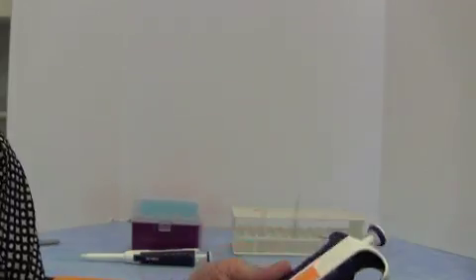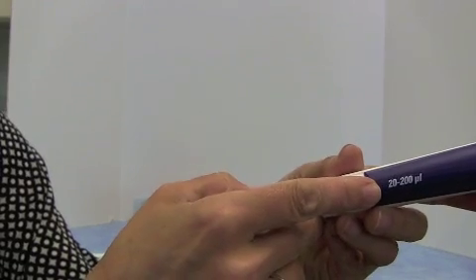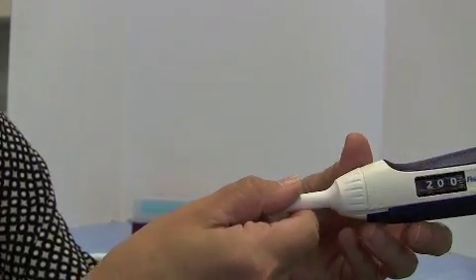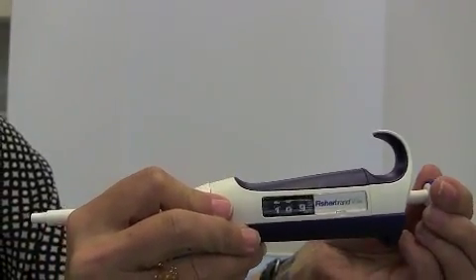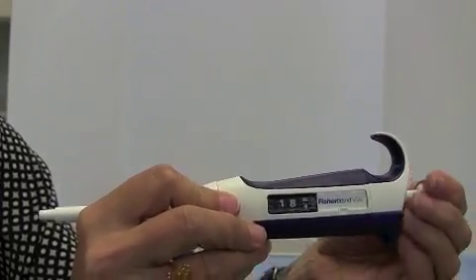The other type of pipette you're going to use is the smaller one. We'd call this a P200. And this one, written on the side, says 20 to 200 microliters. And again, if you look at the dial on the front, this one right now is set to 200 microliters. That's the maximum volume you can do with these. And then you can wind this down.